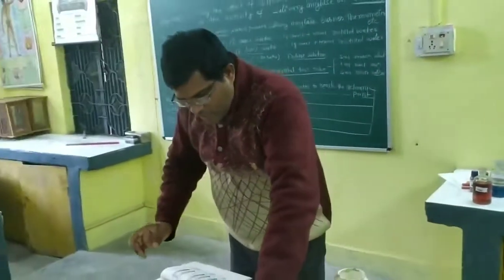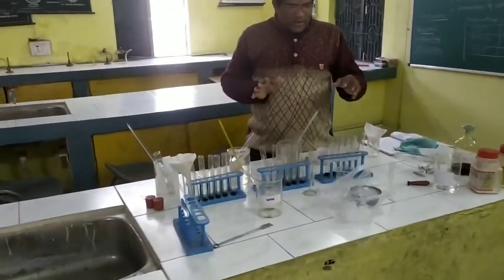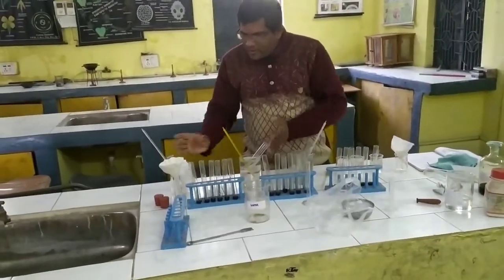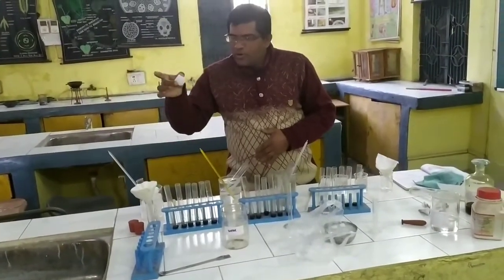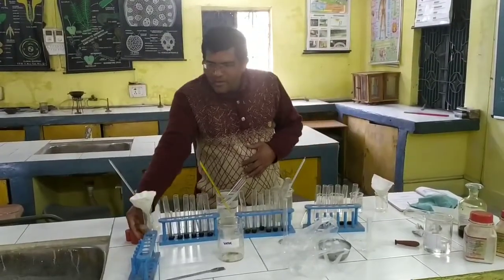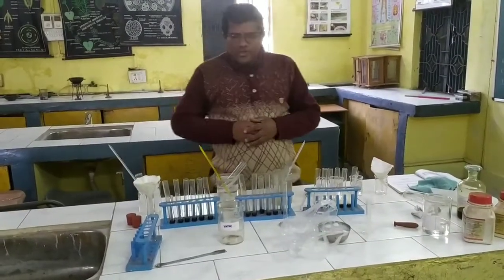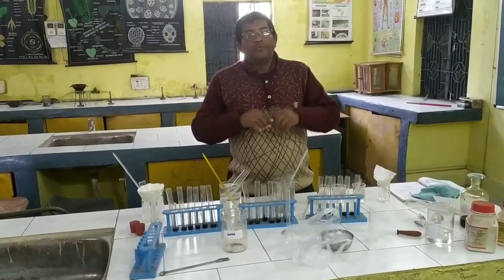Now more things we require. These all are the setup which we require, such as the test tubes. We require the thermometer. We require the boiled water. We require the ice to maintain the very low temperature of the experiment. Then we require the test tube and funnel with the cotton filter for the collection of saliva.